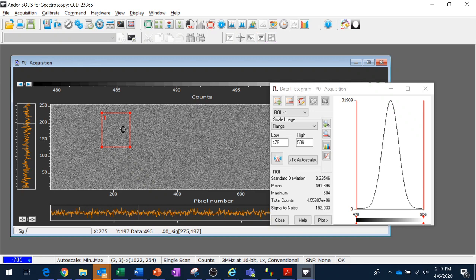No, this is actually an offset applied at the analog to digital converter to make sure all the numbers coming out of it are above zero, which is a bookkeeping trick that makes storing numbers more efficient. So you can imagine this could cause trouble if I'm using this for some kind of photometric application, because it's going to make my background look artificially higher. So what I'm going to do here is subtract a background to get rid of that.